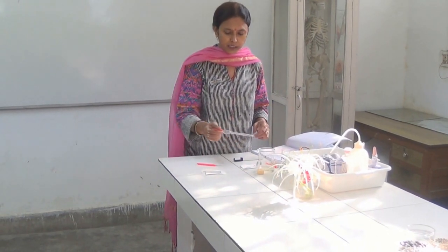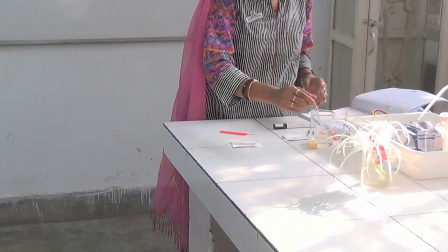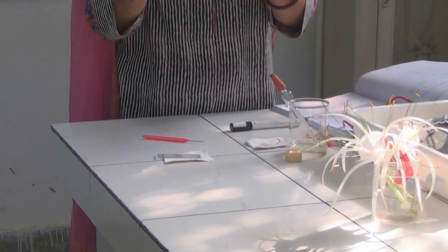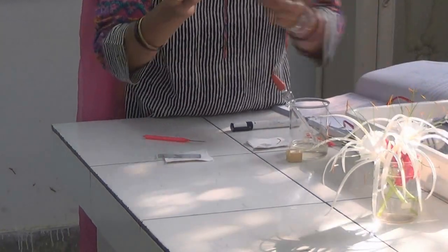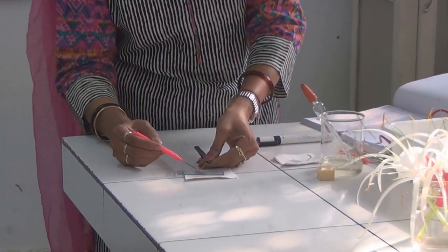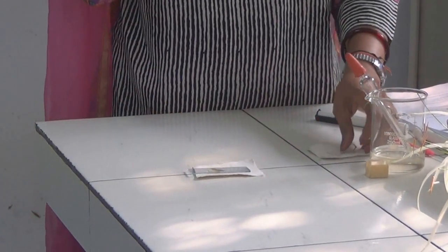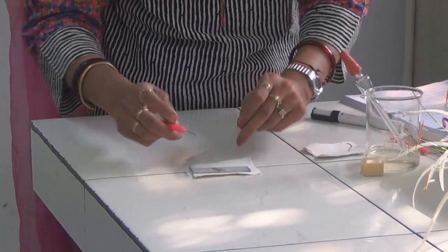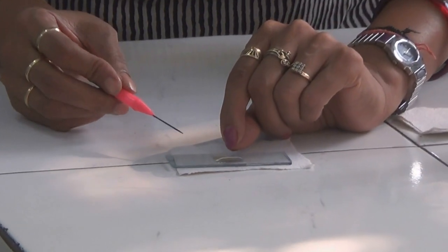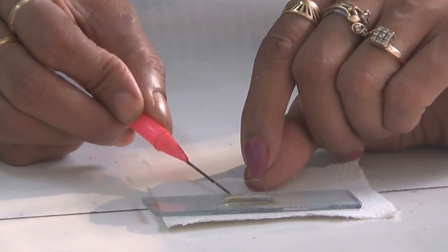We are going to put three to four drops of this nutrient medium in the cavity. Then, we will pluck one anther from the flower and, with the help of a needle, we will dust a small amount of pollen onto the cavity medium. Now, with the help of forceps, we will put the cover slip on the cavity. Please ensure that there should be no air bubble while you are placing the cover slip.